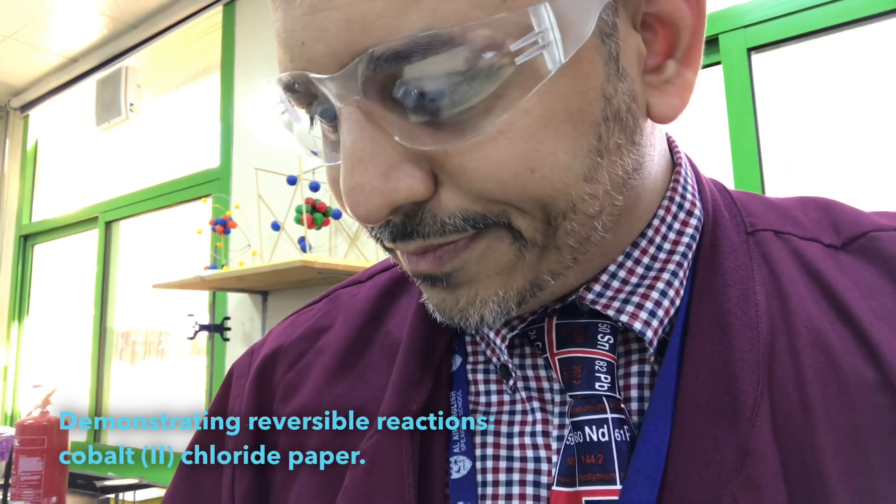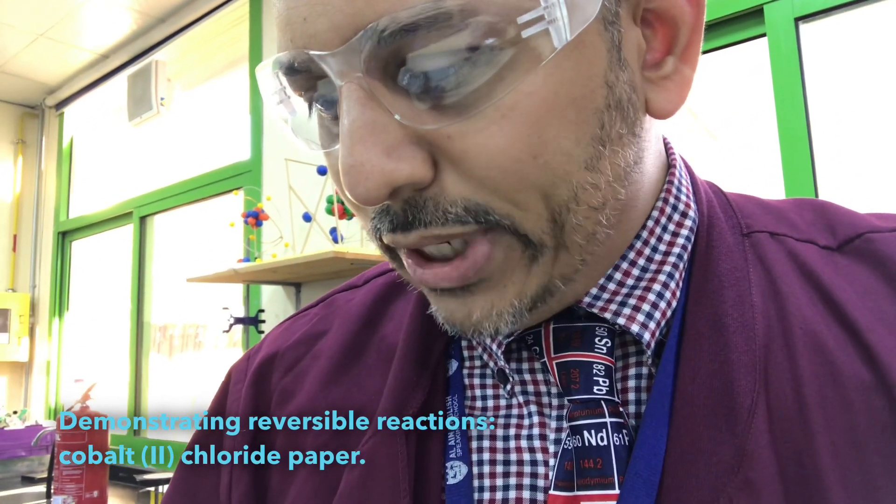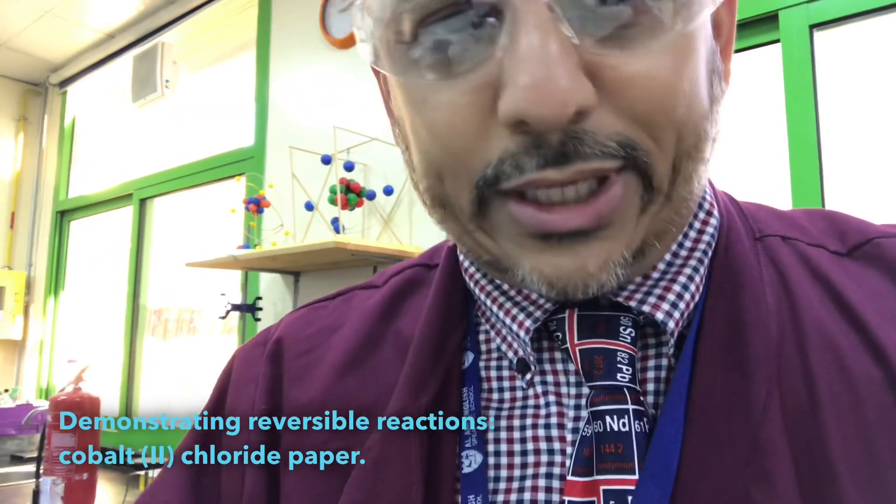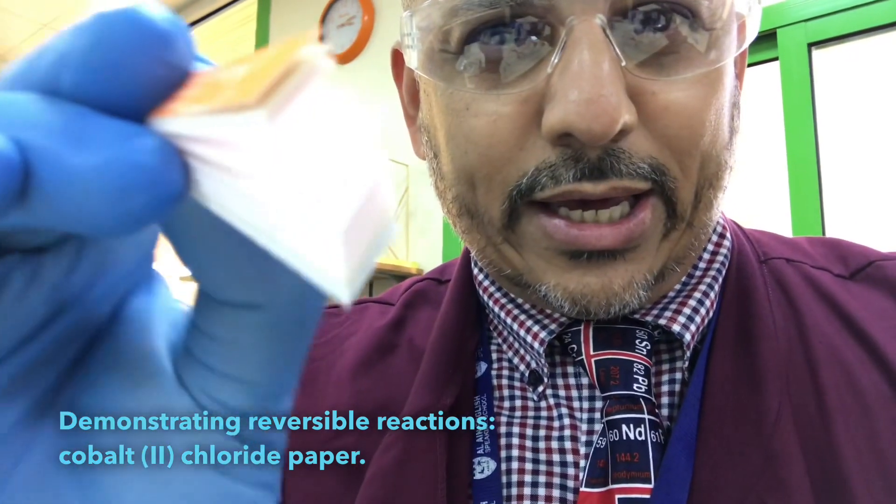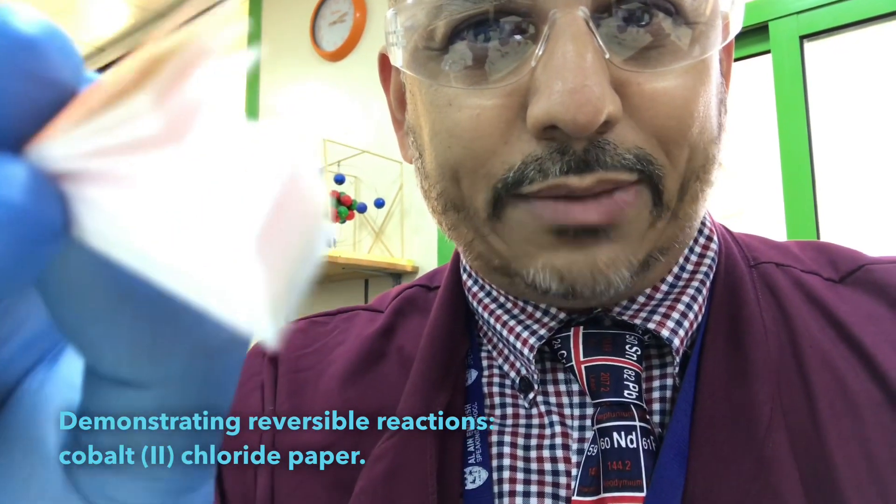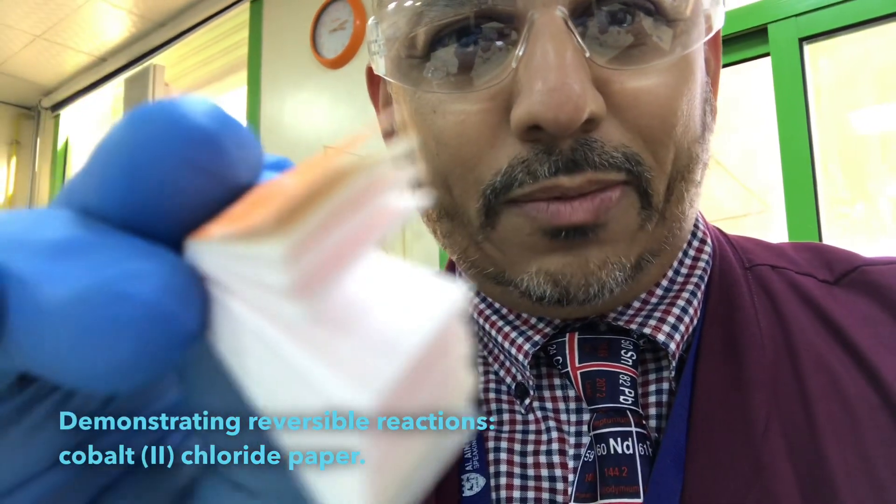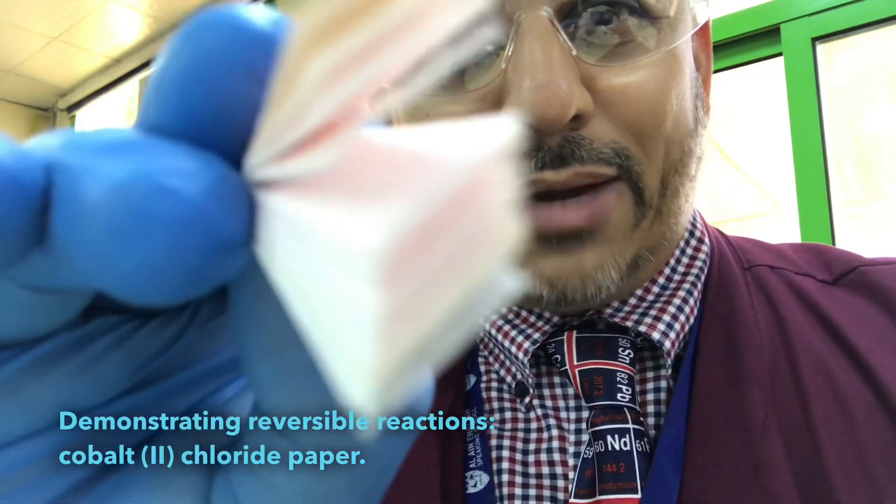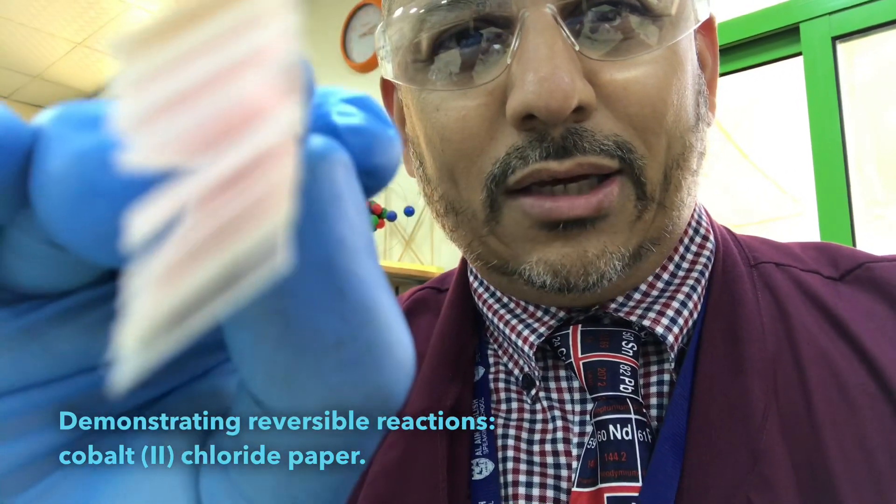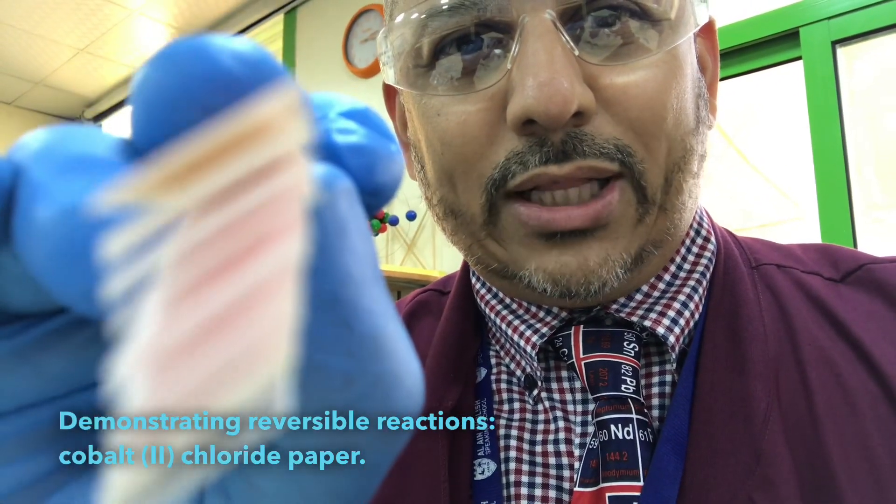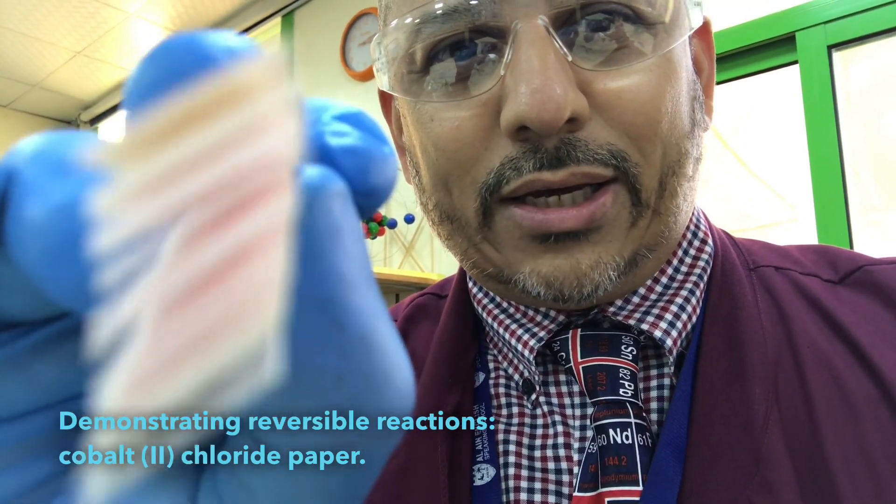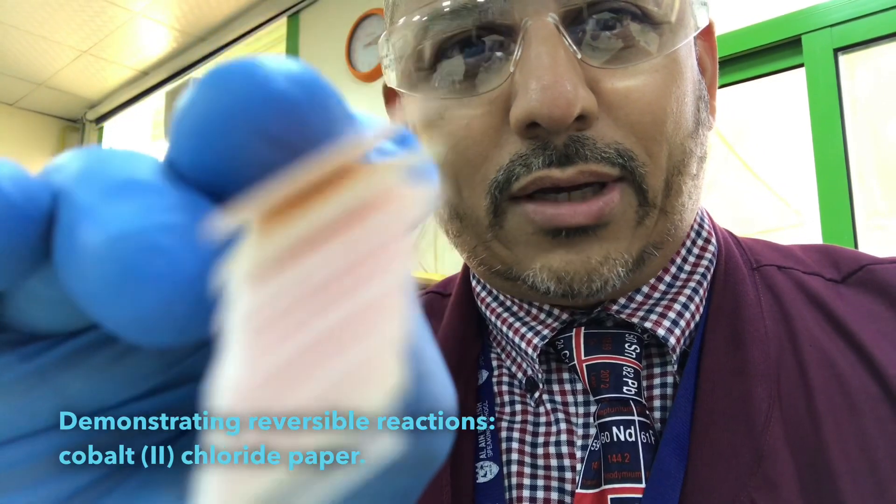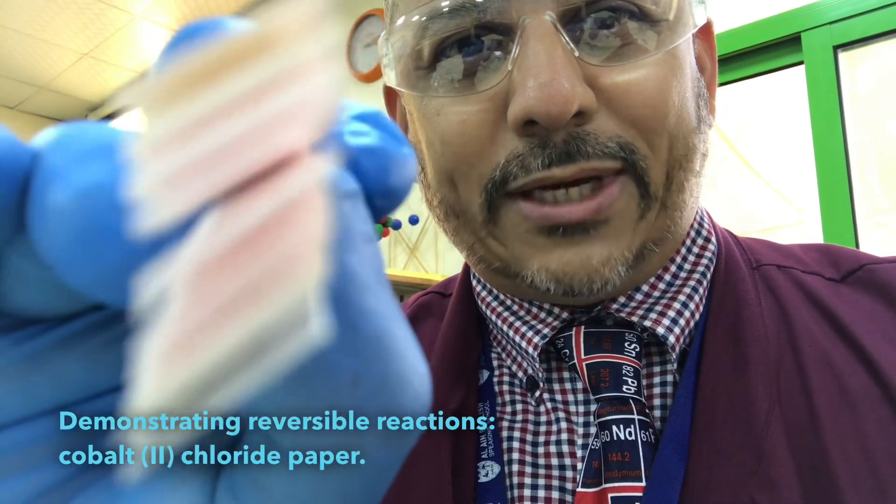Cobalt 2-chloride, when it's exposed to the air, actually turns pink. Now the problem with this is that it's great on camera. I must say it's probably a lot clearer than I anticipated.